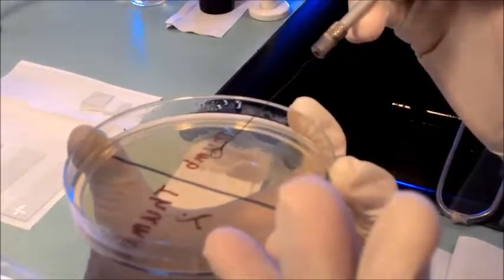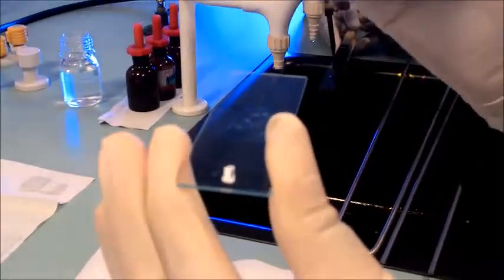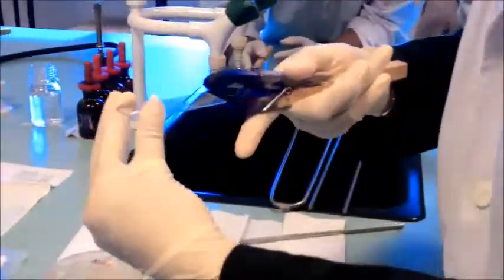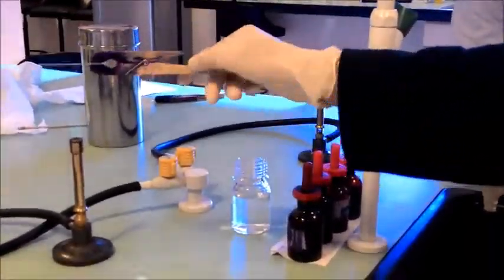Kita ambil koloni dia. Okay. Lepas tu yang sterile balik, lepas tu kita akan heat fix lah yang ni. Heat fix bacteria. Baru kita akan tambah a few drops of crystal violet dalam half or 1 minute lah.